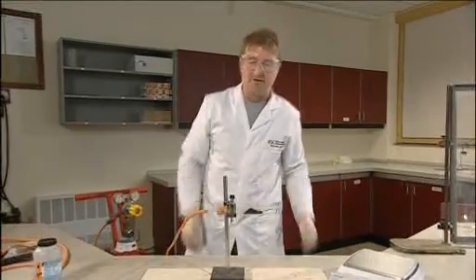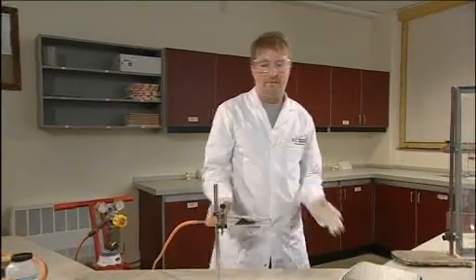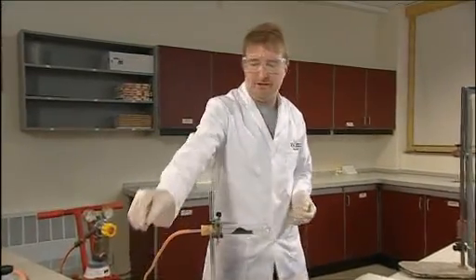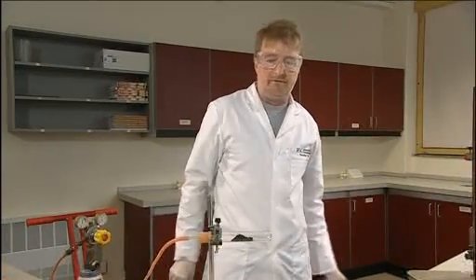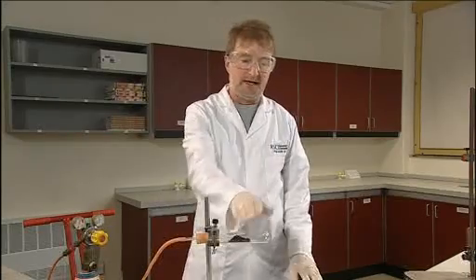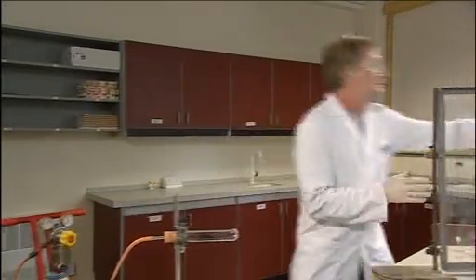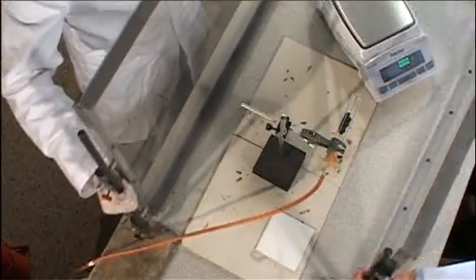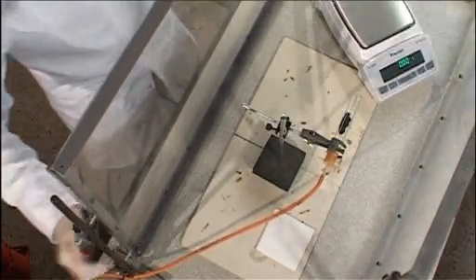The next step is to light the hydrogen, but it's important to wait for about a minute to make sure all the hydrogen has flushed out any air from the reduction tube. Otherwise you could get an explosive mixture in there. For the lighting process, we have safety screens to protect the demonstrator and the audience.